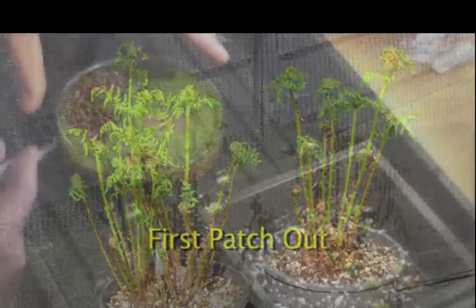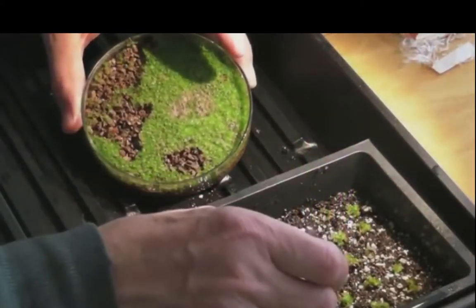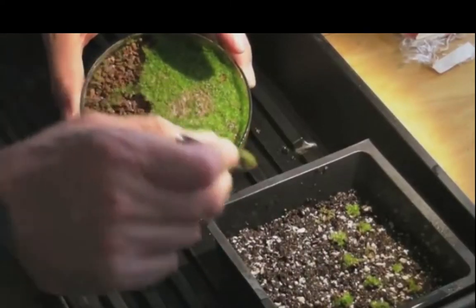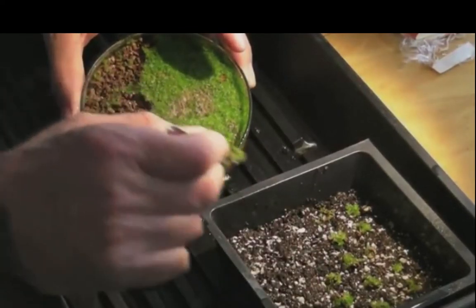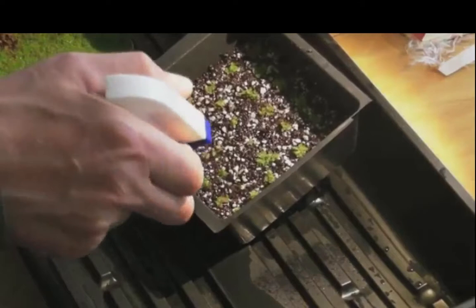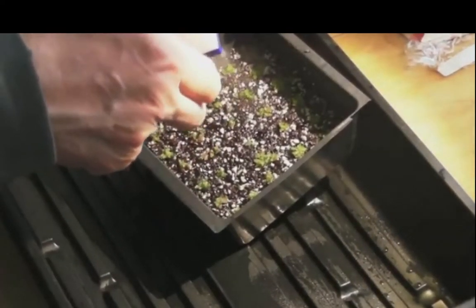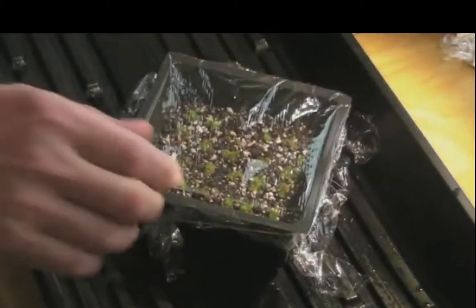When the gametophytes are crowding each other in the Petri dish, it's time for patching out. Prepare a tray of sterilized soil, and using tweezers lift patches of gametophytes out of the Petri and place them gently on top of the soil in the tray. Each patch, containing from 5 to 20 gametophytes, will continue to grow until the gametophytes are fully developed and ready for the sexual reproductive stage. Spray them vigorously with boiled distilled water to put them in good contact with the soil. And then cover the tray with saran wrap to maintain high humidity, which is essential for the fertilization stage.